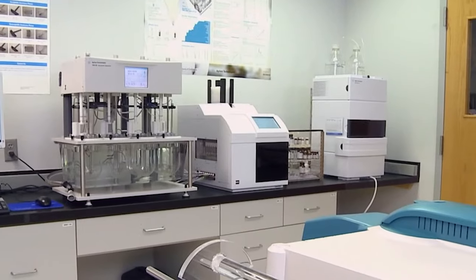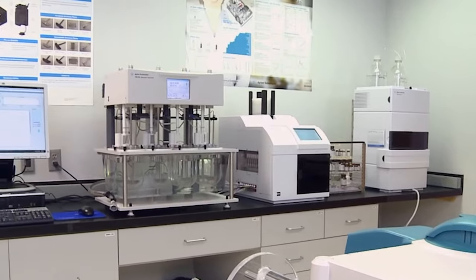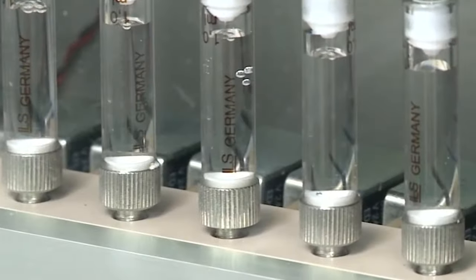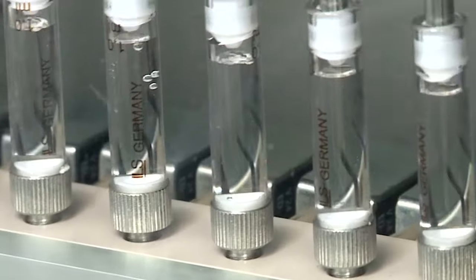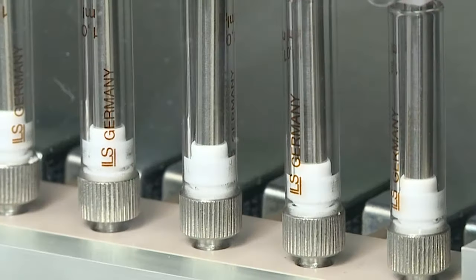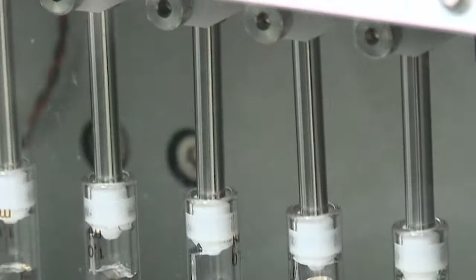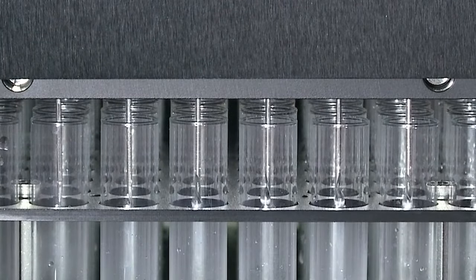Filtration plays a key role in dissolution testing and falls into two main areas. First is to effectively remove undissolved tablet or capsule fragments so only solubilised API is being analysed. The second reason is to remove particulates prior to HPLC to prevent premature blockage of the HPLC column, as this could result in increased back pressure, reduced separation efficiency, or damage to the HPLC system components.